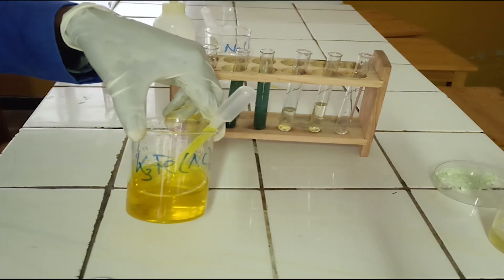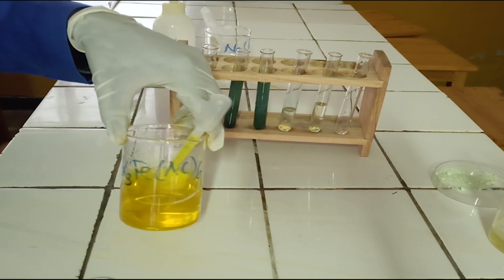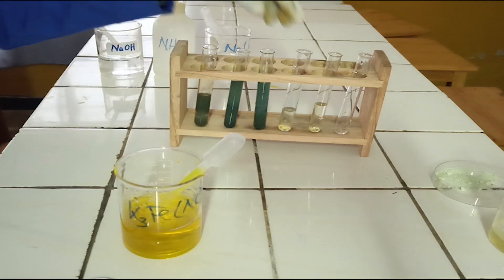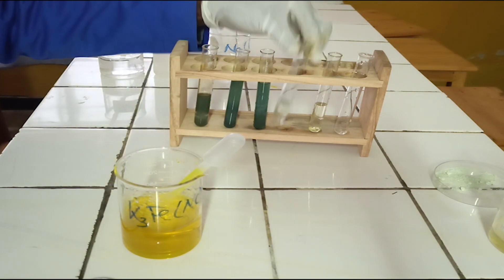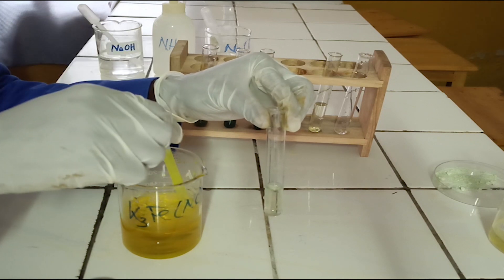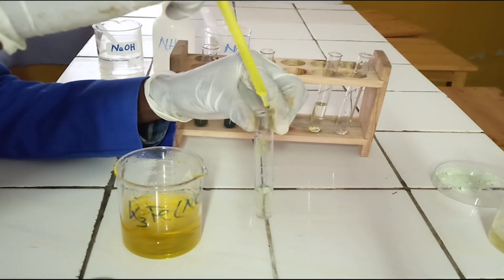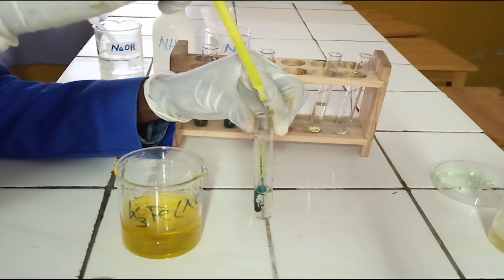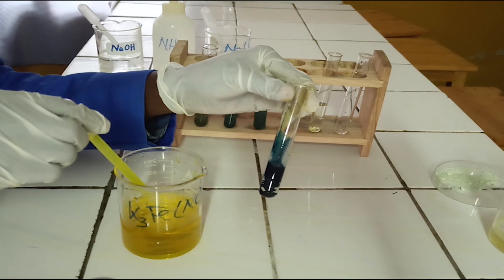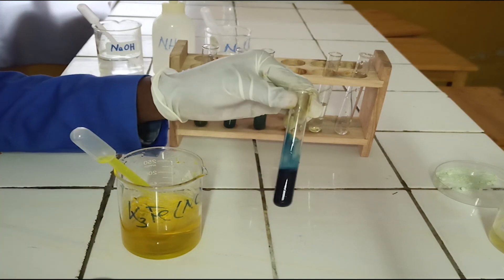Confirmatory test. To the fourth test tube, add a few drops of potassium hexacyanoferrate(III) solution. As you see, potassium hexacyanoferrate(III) reacts with iron(II) ion to form a dark blue precipitate.